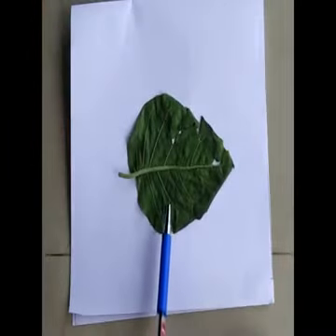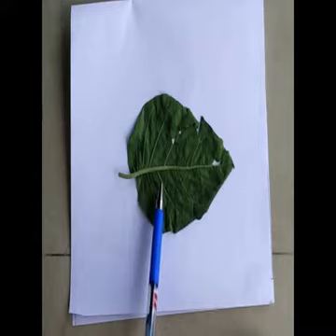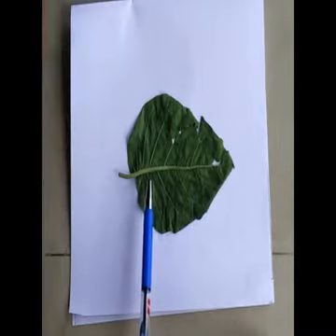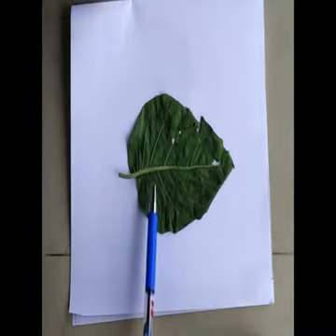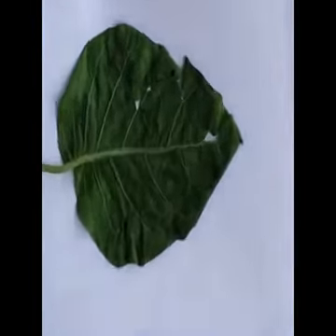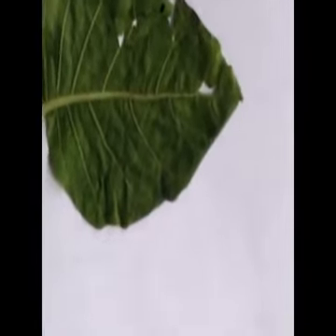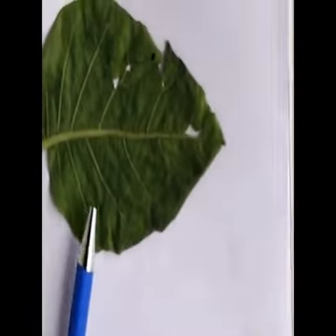As far as the venation is concerned, generally the venation is to be observed only through the ventral surface for a proper identification. And you can see a mesh-like appearance. The mesh-like appearance is formed when the venules intersect with each other.